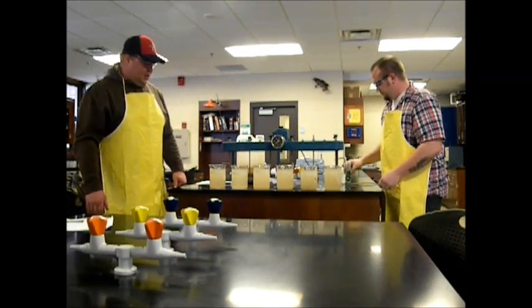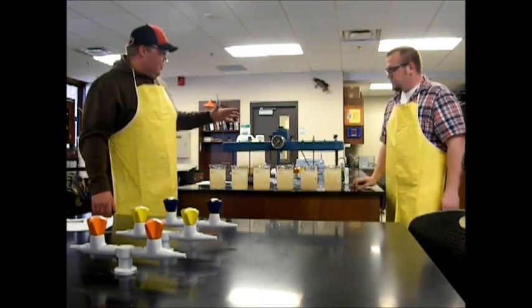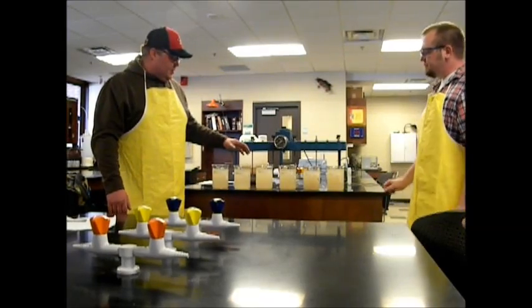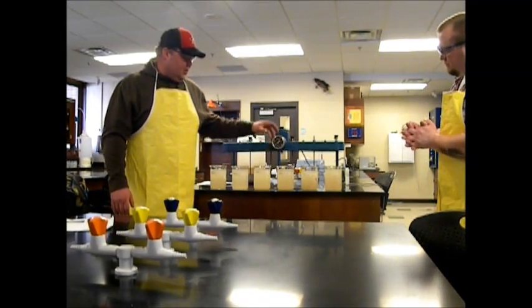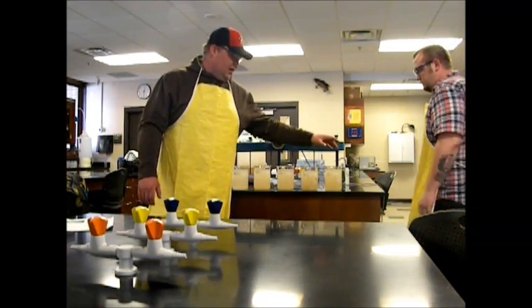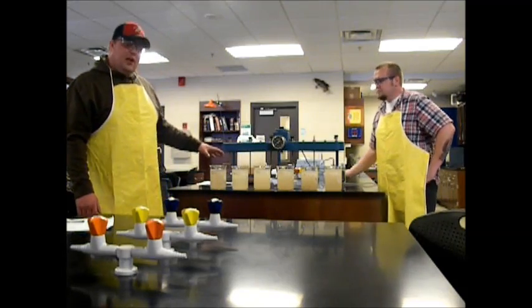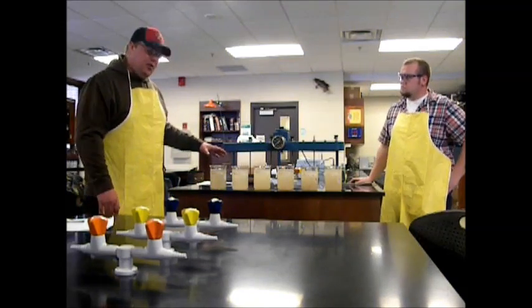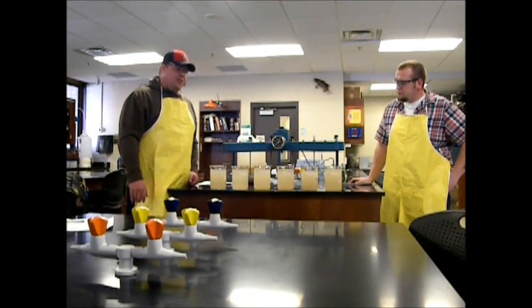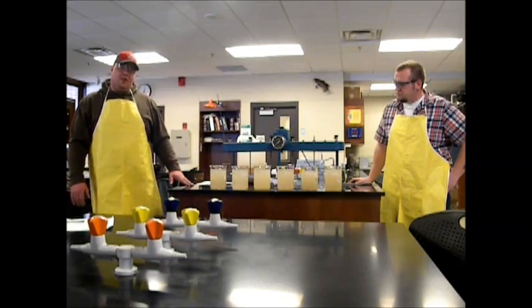Just so you know, we used our polymer stirrer. We added 5 milliliters to this beaker, 25 to this beaker, 50, 75, and 100. And this beaker was our control, so we did not add anything to that one, so we can test off that.